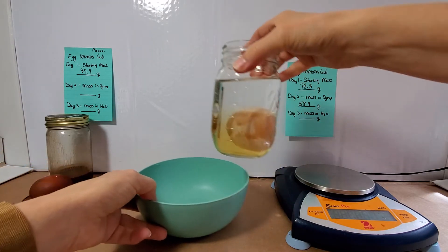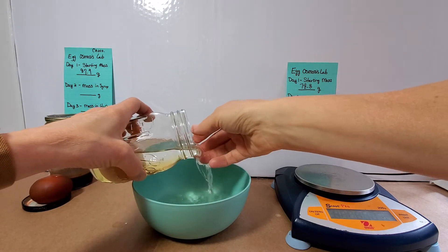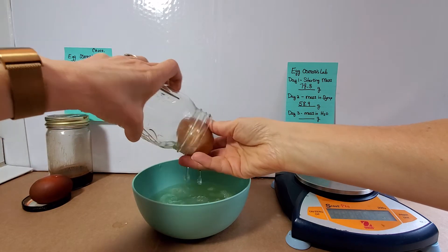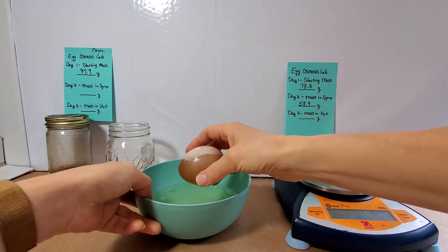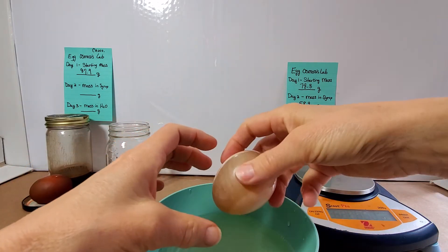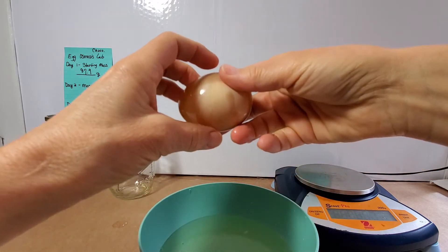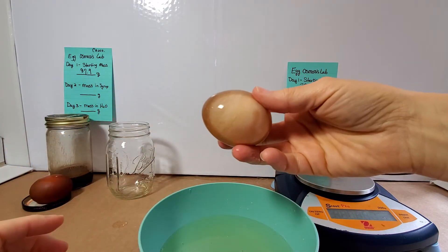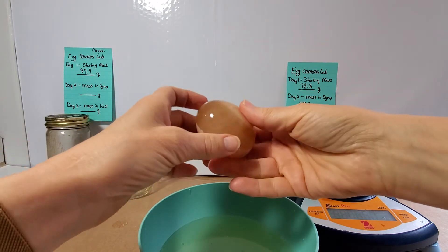What we're going to do now is take a look at our egg. Yesterday our egg was all wrinkled — kind of looked like an old egg — and it was squishy. Today you can see, oh there's some of that shell I wasn't able to get off. I can actually see a little bit of the yolk in there moving around as I'm twirling it. It's back to feeling like a bouncy ball, just like on day one.